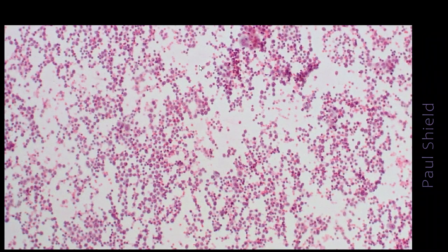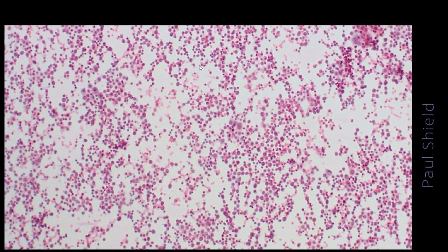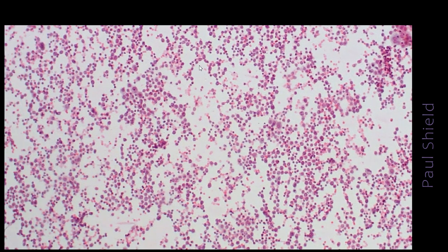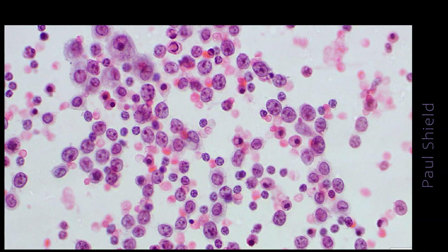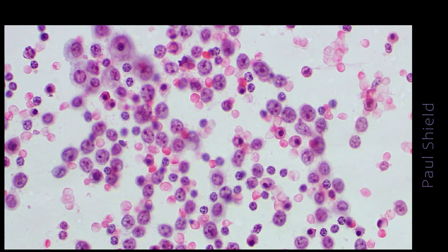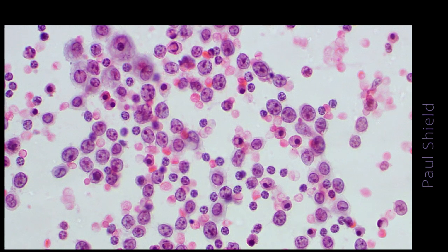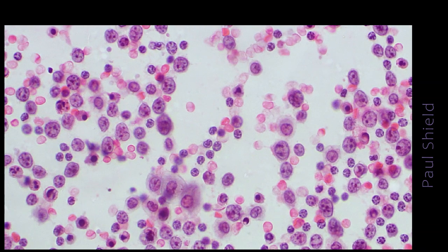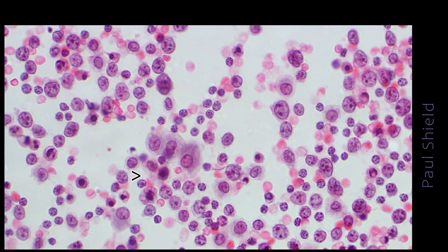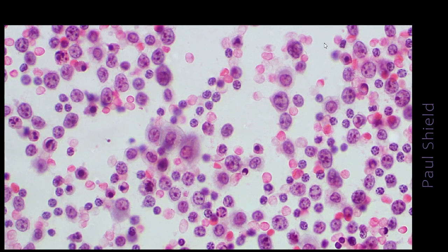This is the PAP, and as usual with lymphomas it's not as useful. But again I can see a dispersed population, so that's reassuring for a lymphoma. The nuclei in high power have quite a lot of nucleoli, which is sort of a variable thing in lymphomas. There's some mesothelial cells there, some more down here. And again, I can see really what looks like almost two populations of cells. These are mesothelial with sort of smaller, more mature lymphocytes there.